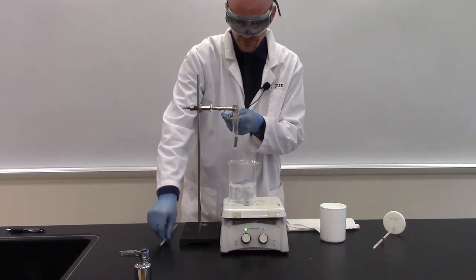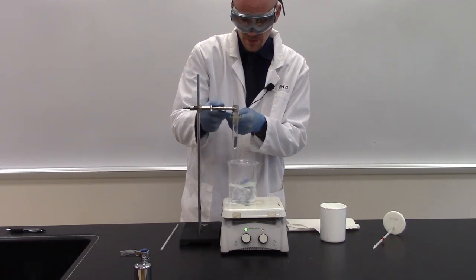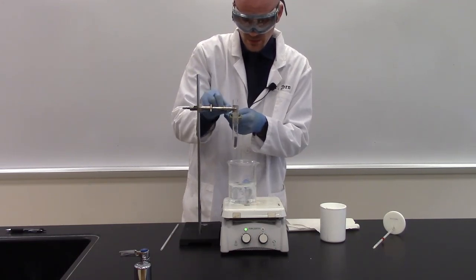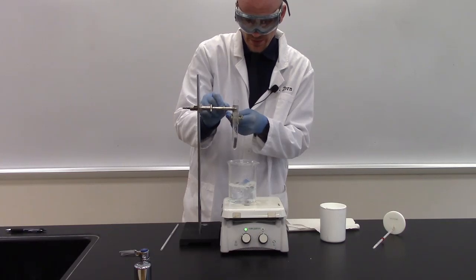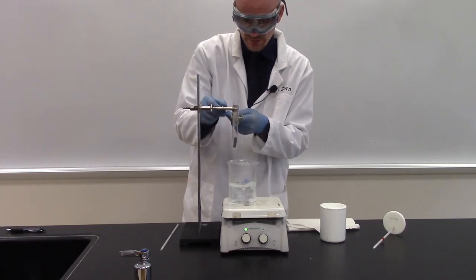and then I'm going to transfer my piece of metal from the test tube to my calorimeter. And then quickly put the lid back on top. It's a lot that needs to happen.